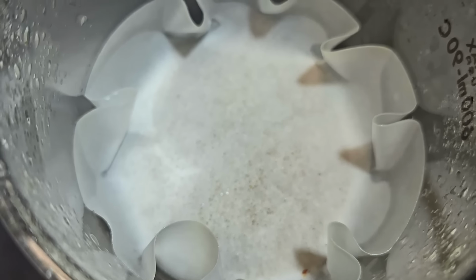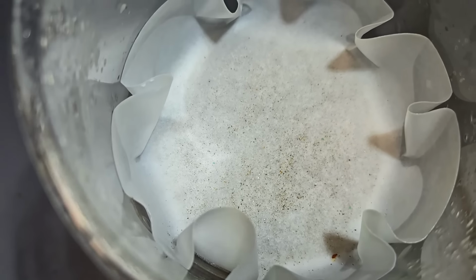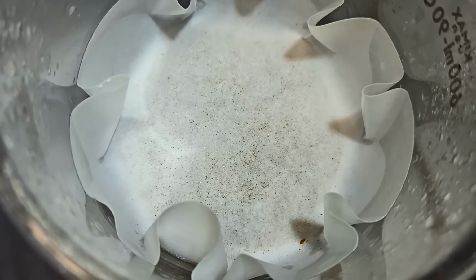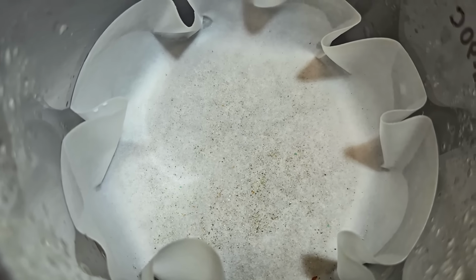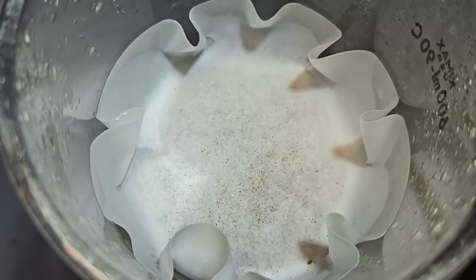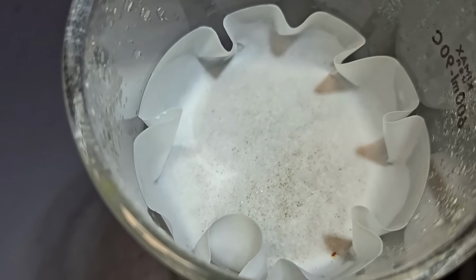Check that out. That is one clean filter. Just some miscellaneous debris down there. What it is, I don't know, but I see a little piece of solder mask maybe over there. Actually, I see a few pieces of green solder mask, but yeah, I'm not surprised to see some debris. Yanni pulled all these pins out of PC boards. I'm sure some PC board debris came with him. But that's a pretty clean filter. All right.